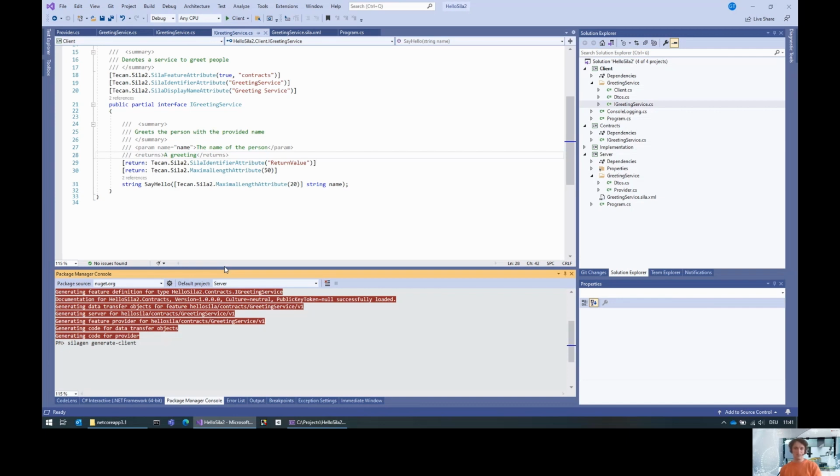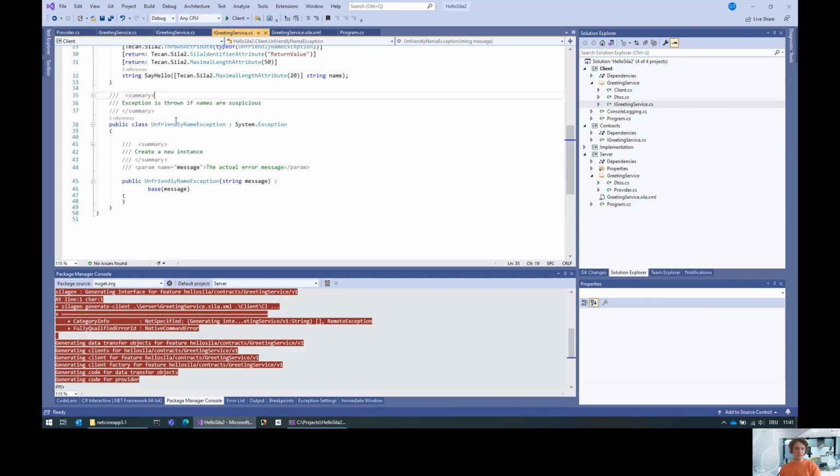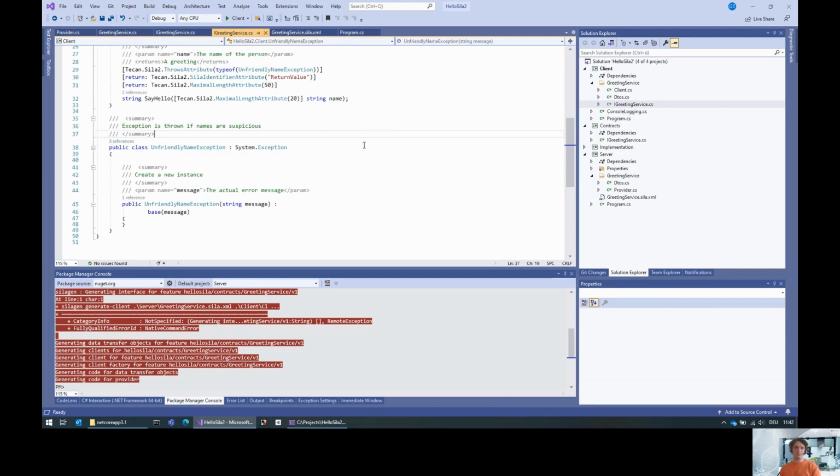The first argument was the server feature, and then the second one was the client CSproj. And we also give it the namespace. And what happens is we have an unfriendly name exception here. And the generated code otherwise also makes use of this exception. You see a couple of references here.